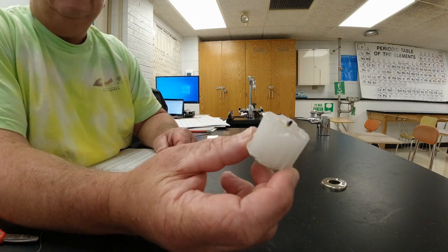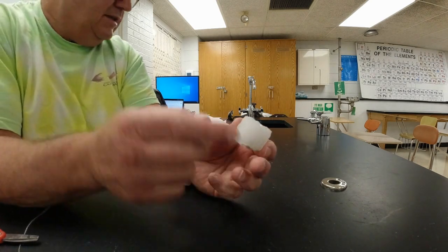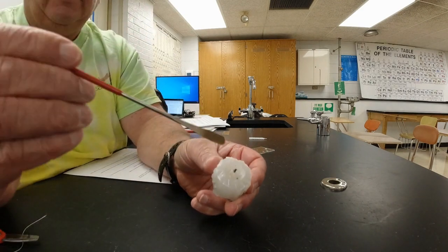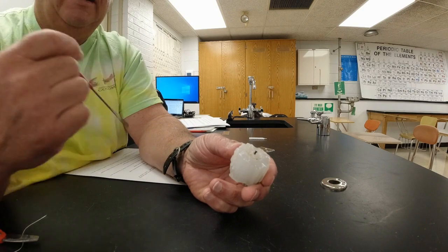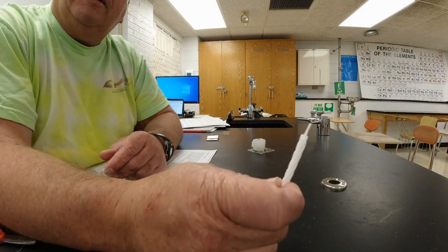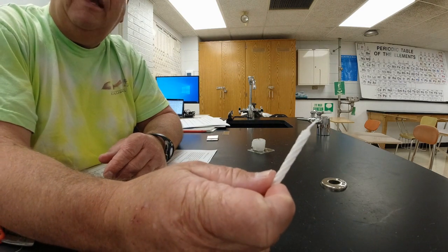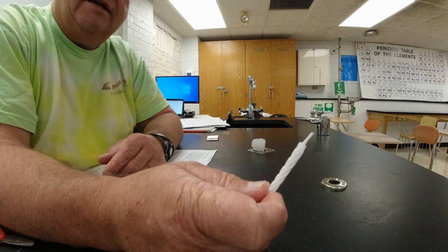The candle is cylinder shaped. It's got two parts to it. It's got a wick, which you can see this candle has been well used, but you can see right there, that black part, that's a wick that's already been burned, and the rest of it is just made out of wax. We could use that candle, or in a minute, we're going to use this candle, which is just a birthday candle, with a little bit more of a wick exposed so you can see what's going on.